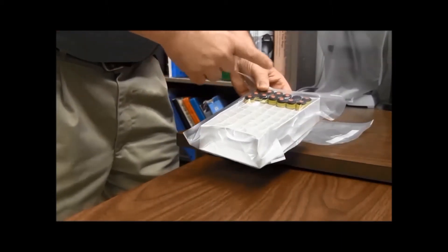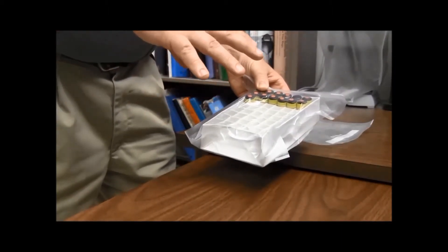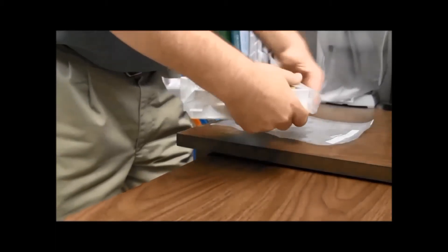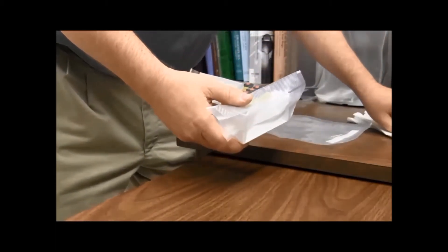So the next step is you have to put this in another bag and heat seal that. But on this you have to add an absorbent material.